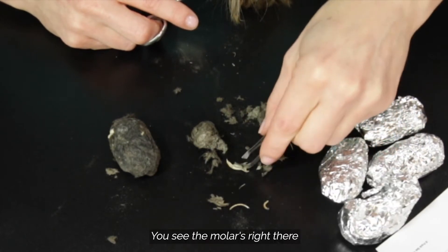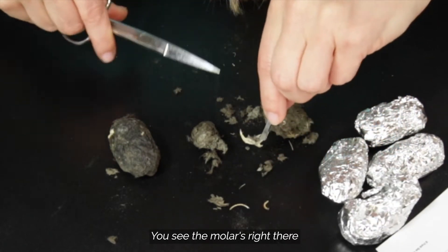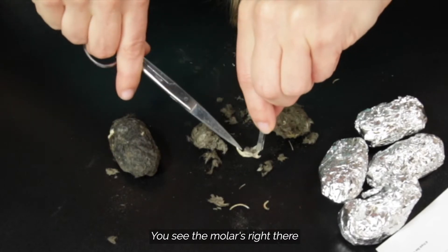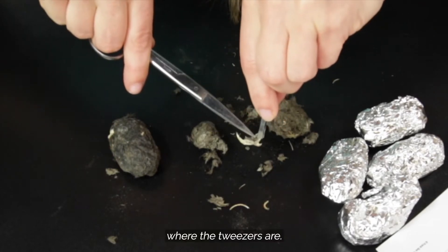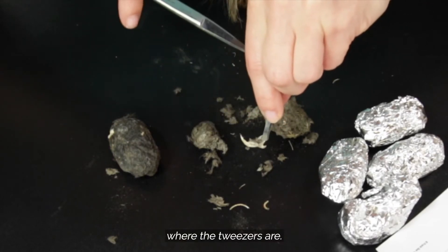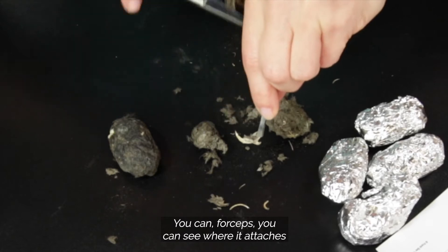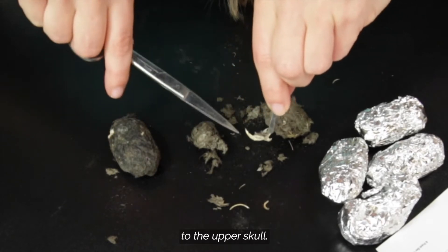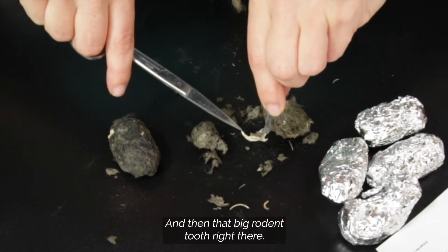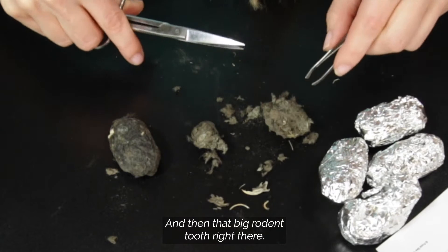You can see the molars right there where the forceps are, and where it attaches to the upper skull, and then that big rodent tooth right there.